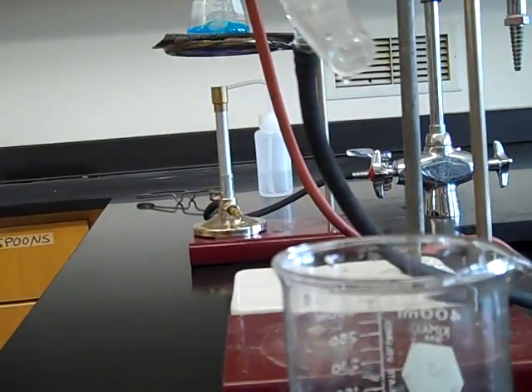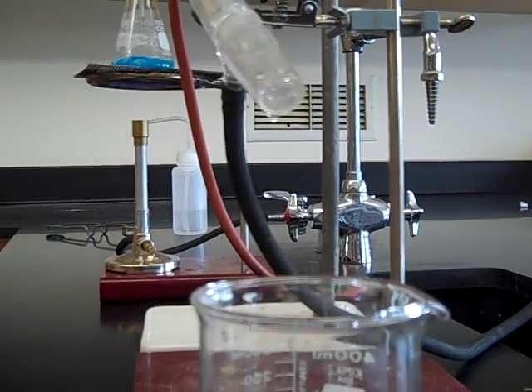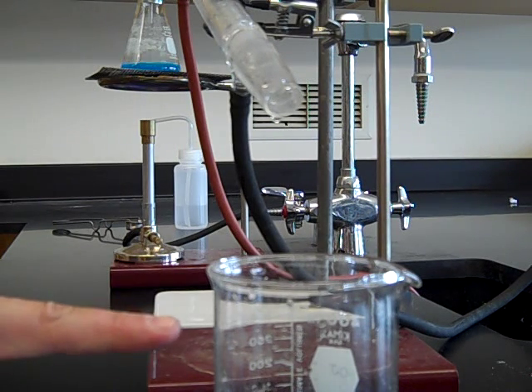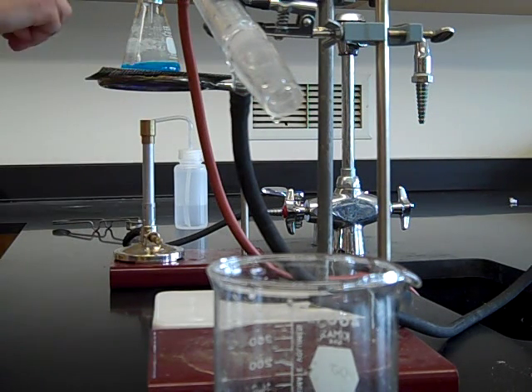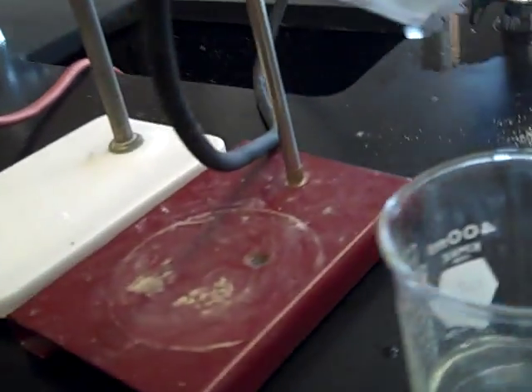And you can see on the end here that what we have is our water from our mixture dripping into a collecting beaker.